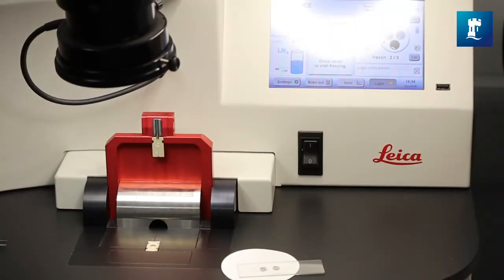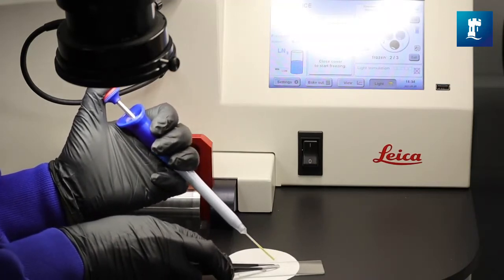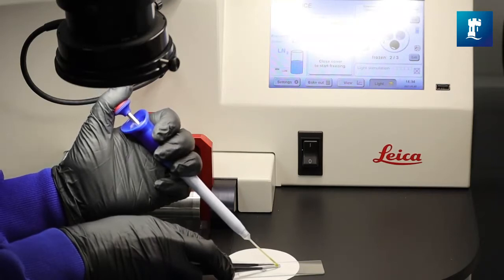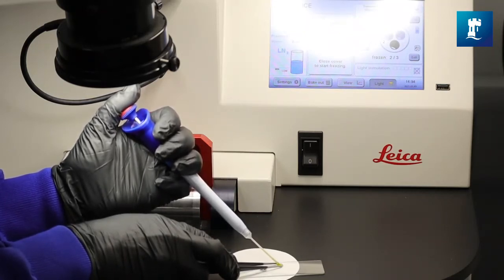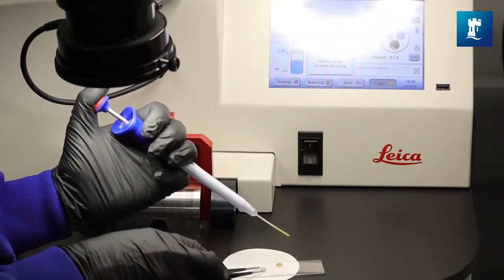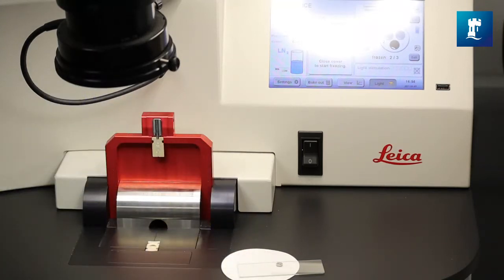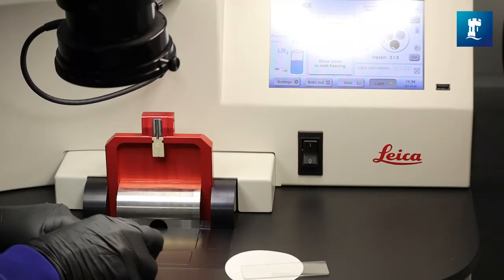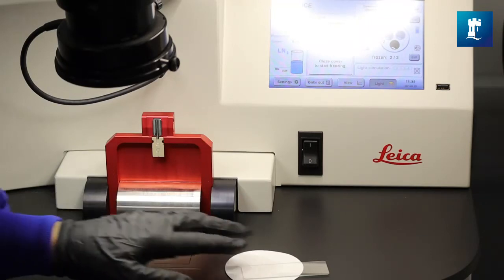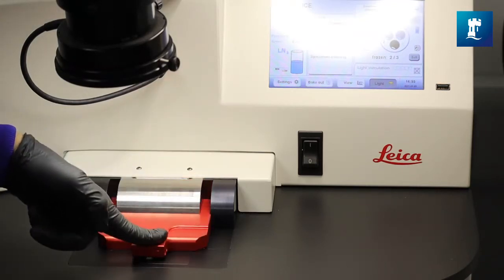The sample I'm using for this demonstration is homogenized plant material. It's a really nice bright green and it's also liquid so I can pipette it so it's nice and easy to show for a demonstration. I have got two planchettes on top of a clean microscope slide. I have scored the inside of the planchettes and I have marked the reverse side so that I can easily identify them afterwards. And then I merely draw up some of my solution, hold the planchettes so that they don't stick to the pipette and then I'm smearing the sample across the planchette. And then I'm going to place another planchette on top and put both of those into the carrier system that I've already placed in position. I'll just give it a quick dab with a filter paper to make sure there's no liquid on the surface and then I remove everything from the sample preparation area.